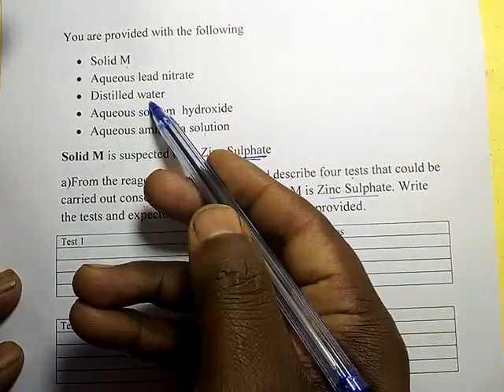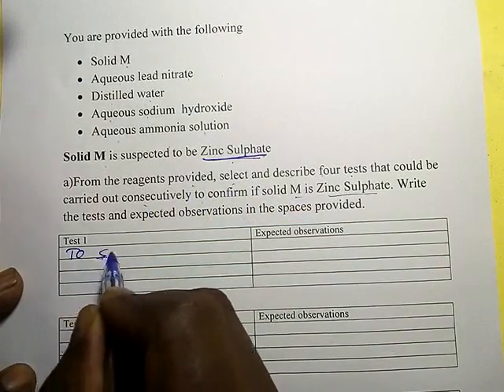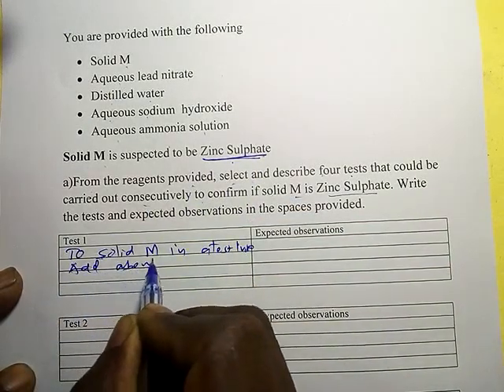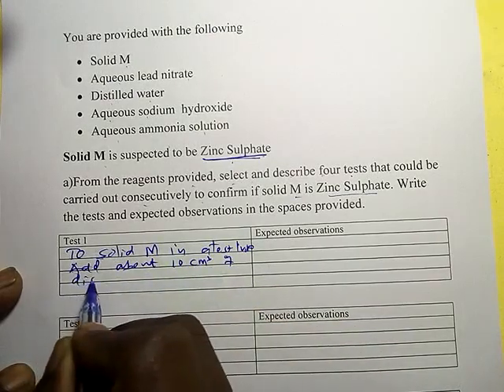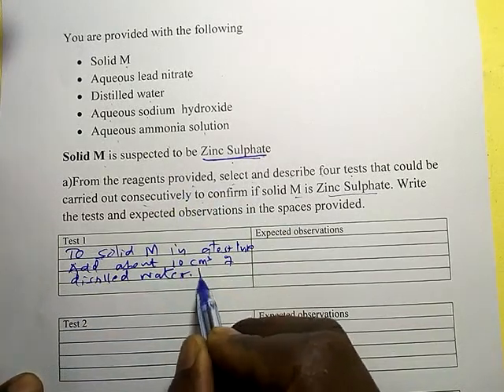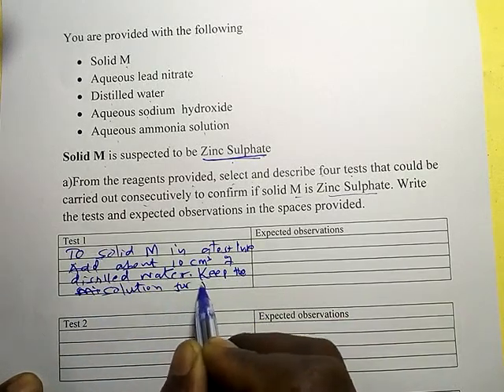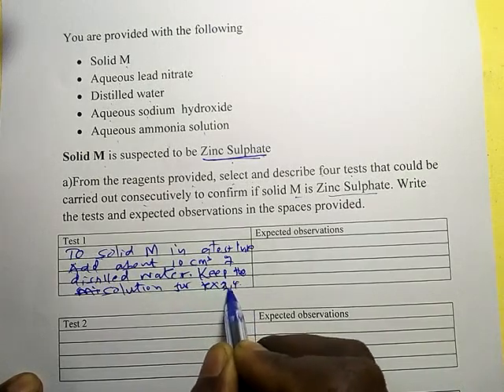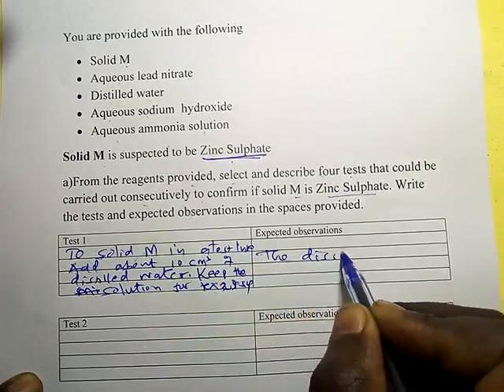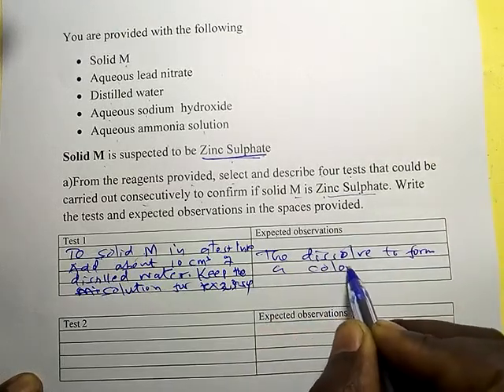The first thing we need is to get a solution of zinc sulfate — that is why we have distilled water. Test 1: add solid M to a test tube, then add about 10 cm³ of distilled water to form a solution. Keep the solution for tests 2, 3, and 4. The expected observation is that the solid dissolves, because all sulfates are soluble, and zinc sulfate will dissolve to form a colorless solution.